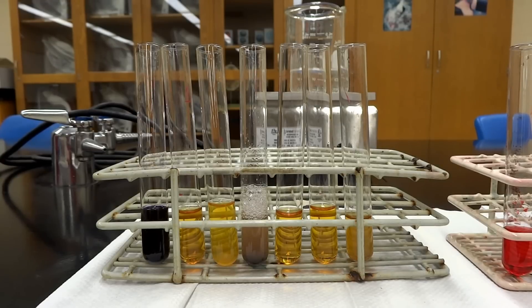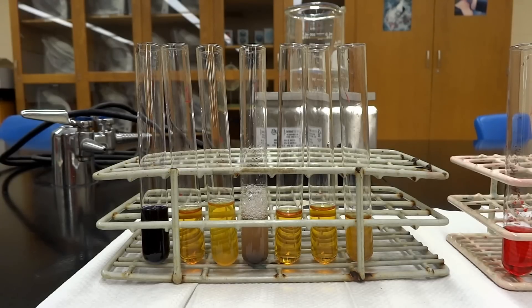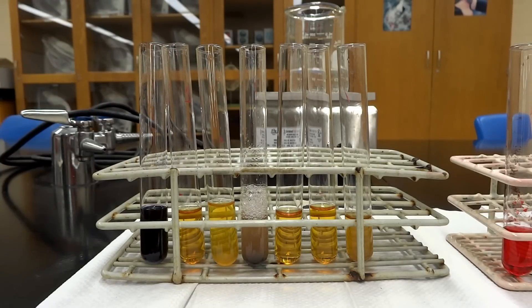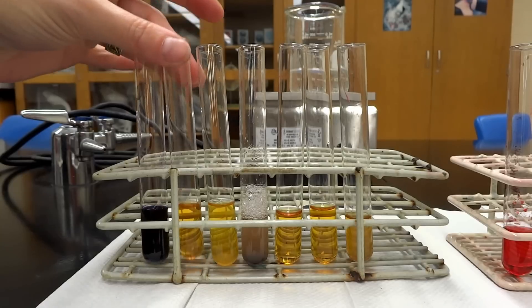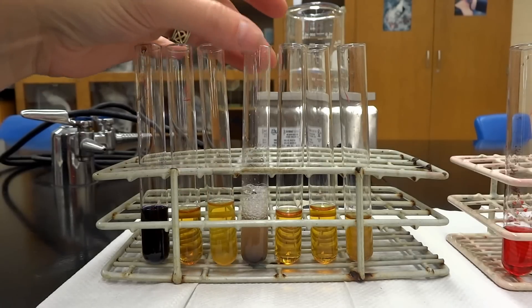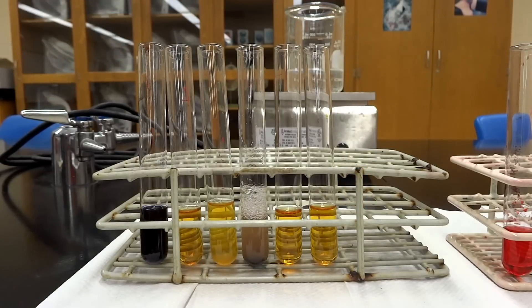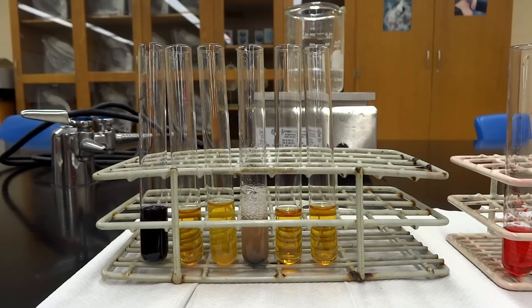Moving on to 4.2, which is testing for starches — complex carbohydrates. As we saw in lab three, when iodine and starch mix you get bright purple, which almost looks black through the camera, but you will see a purple hint when you do your test. Again, test tube one is a starch solution positive control, test tube two is water negative control. Test tube three is onion, four is potato, five is glucose, six is reducing sugars, and seven appears to be the unknown that was tested.